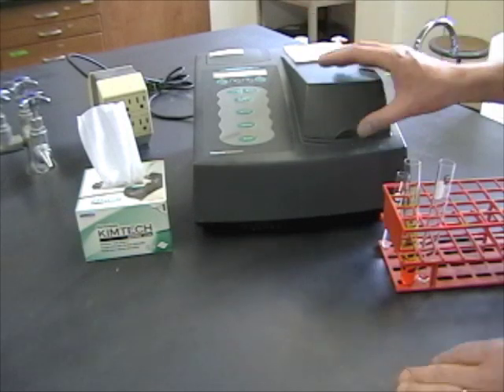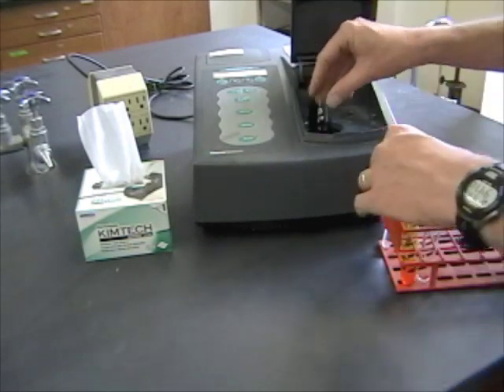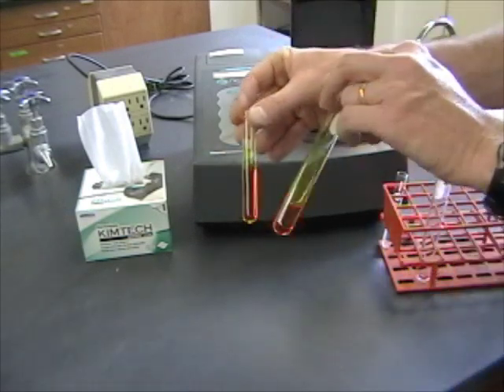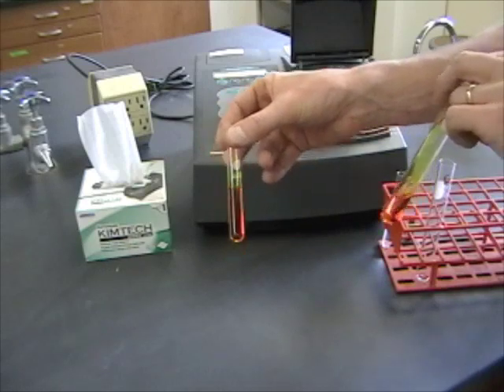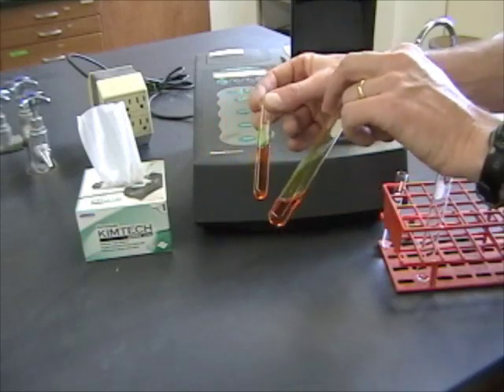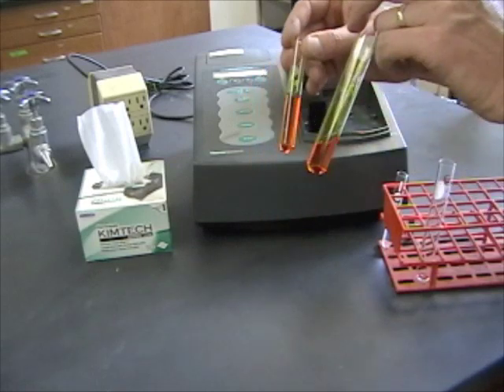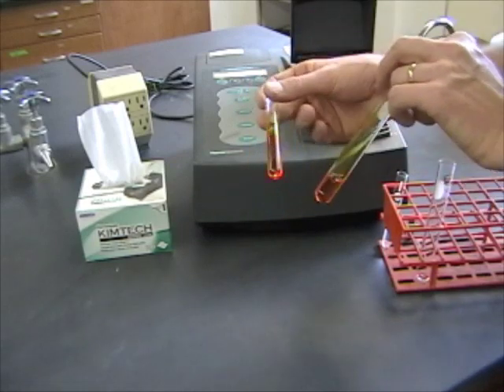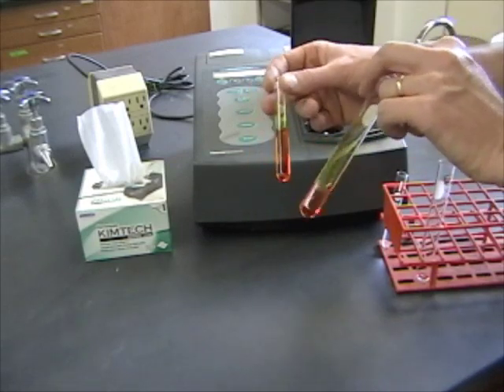It's 120 seconds later, and this reaction is done. You'll see that you can actually see that amber color in the spectrophotometer tube and also in the leftover mixture that you have in your big tube. This is kind of important to clean up quickly because this amber material will stain the tubes.